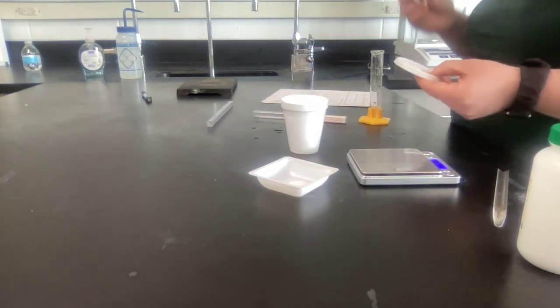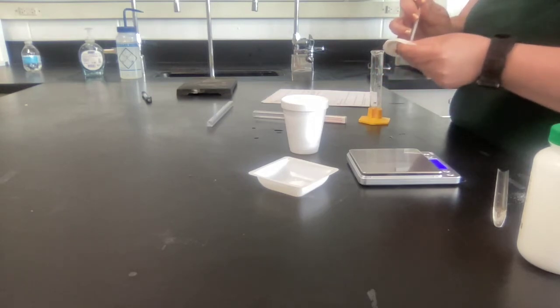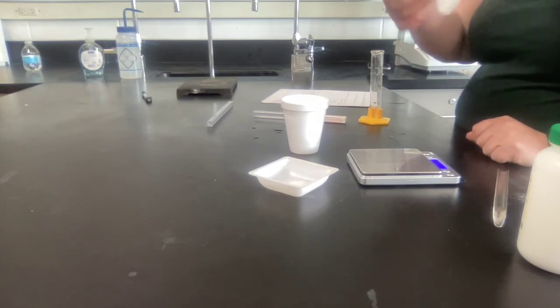What I then suggest doing is taking the thermometer and the cover of your cup and just poking it through the cover like this.